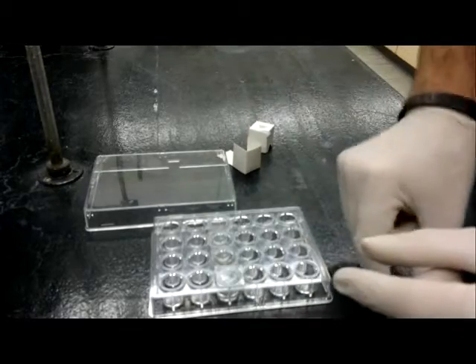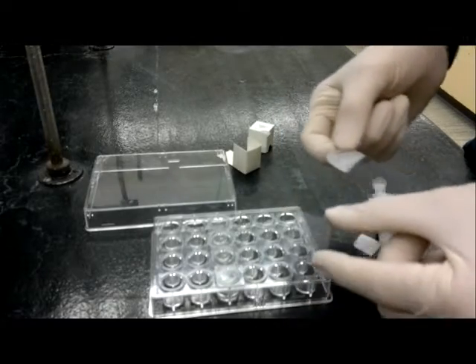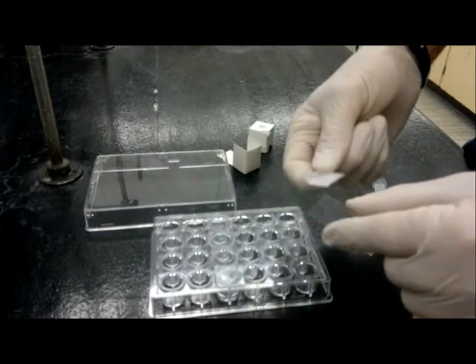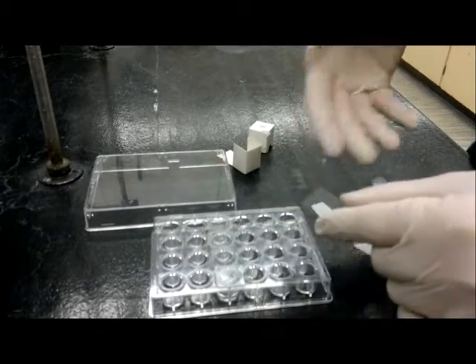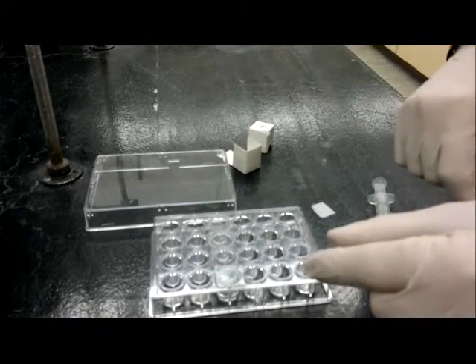Take the papers off of the cover slips and away from the cover slips before you start using them. What I've discovered is there's enough static electricity built up with the paper. If you put a drop together in the center of the cover slip and then pull the paper off from underneath it, the static electricity will actually pull the drop and spread it all over your cover slip.